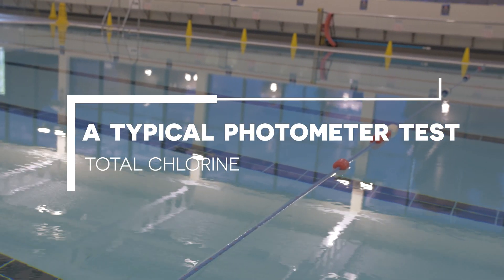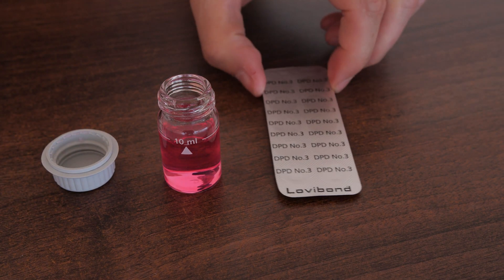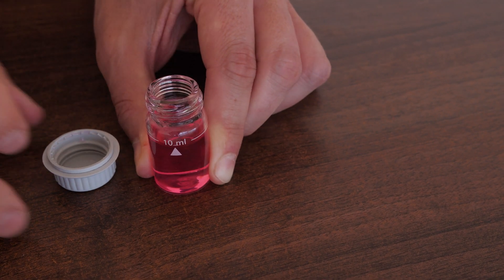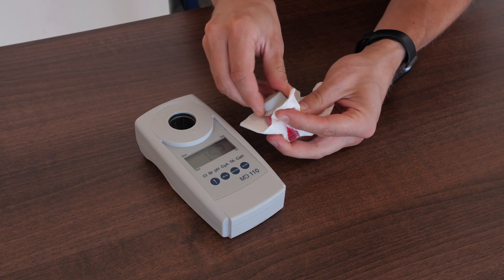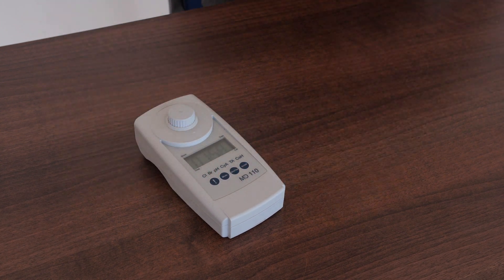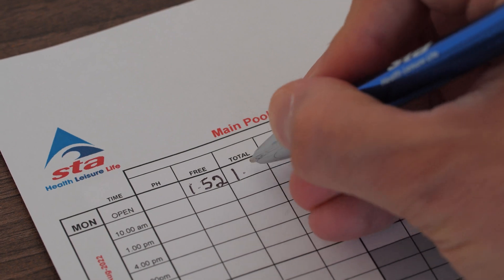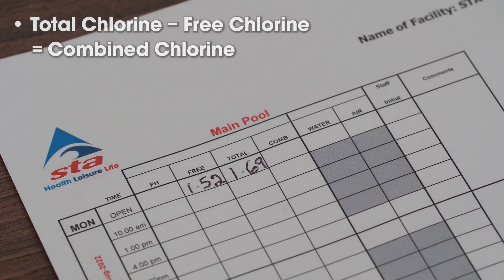A typical photometer test for total chlorine. The coloured sample by which the free chlorine reading was obtained is now used to test for total chlorine. Add a DPD number 3 tablet to the free chlorine solution, avoid touching it. Crush and stir with a cleansed stirrer. Select total chlorine test mode, insert the pink sample and measure the total chlorine, ensuring 2 minutes have passed since mixing the DPD number 3 tablet. Many photometers have a built-in timer that takes the reading automatically after 2 minutes. Record the result. For the combined chlorine calculation, subtract the result of the free chlorine test from the result of the total chlorine test — this sum provides the concentration of combined chlorine.